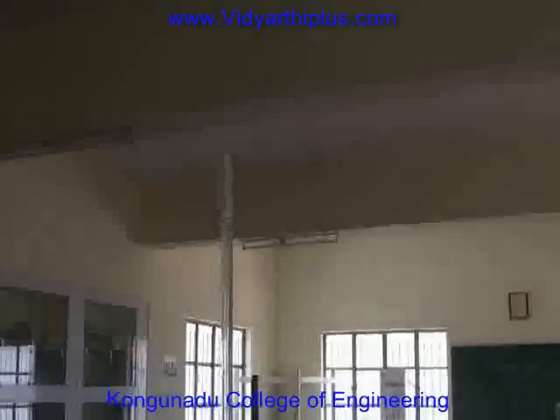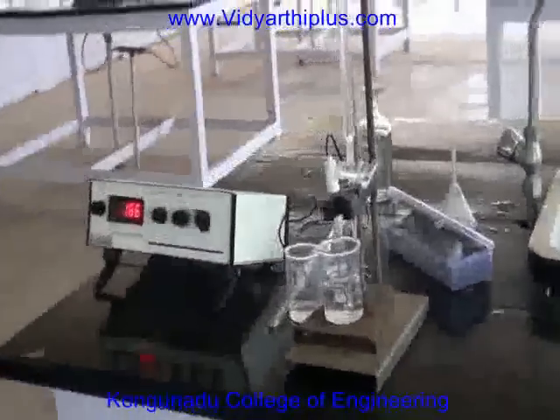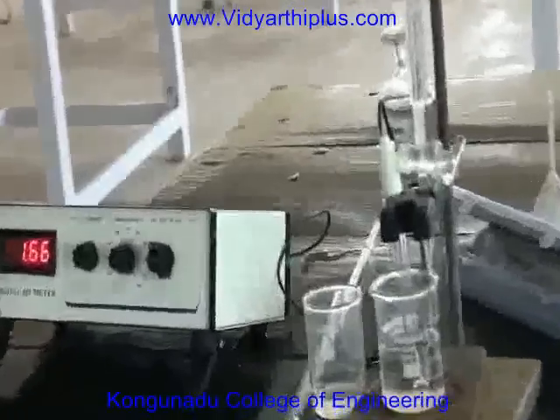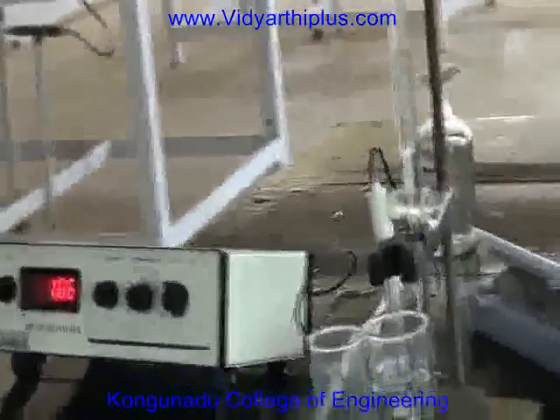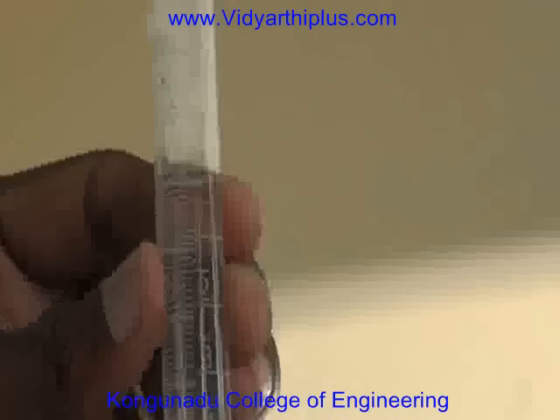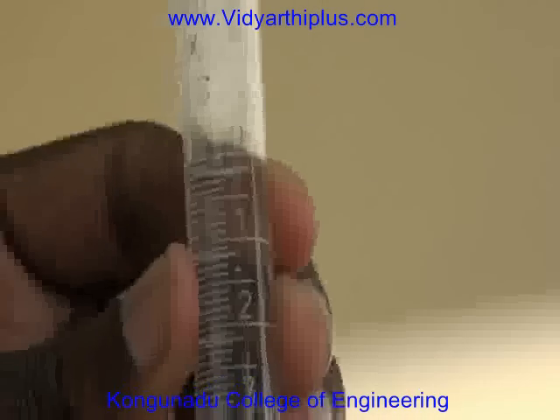Without adding sodium hydroxide from the burette, I am noting the zero value of the pH of HCl present in the beaker before adding any base.